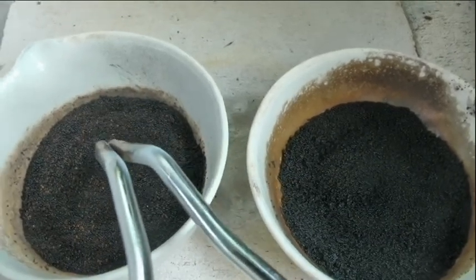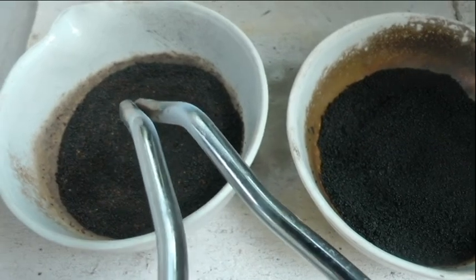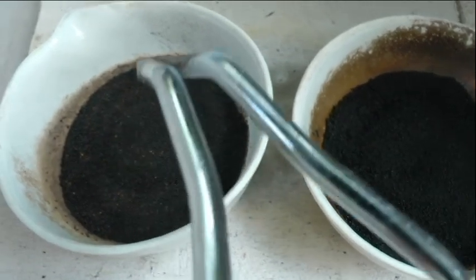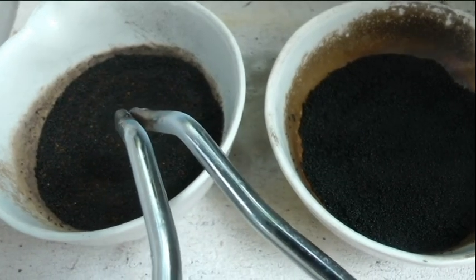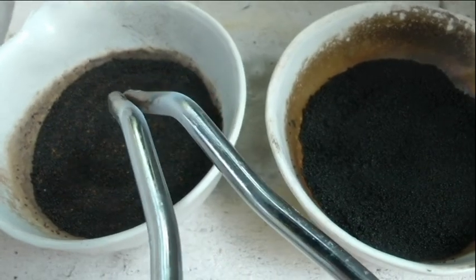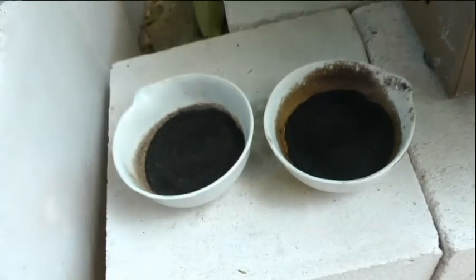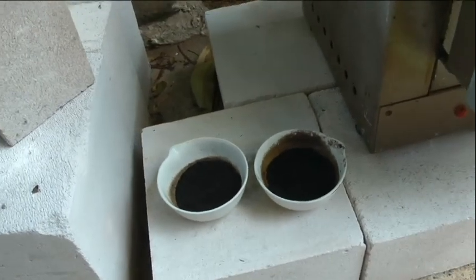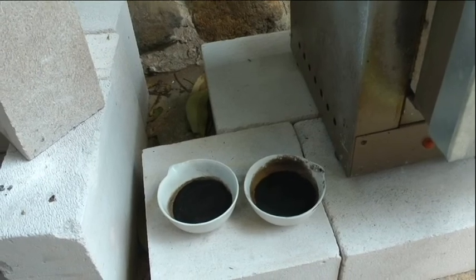This is a new batch I've been leaching for several days. Part agitated, part with the fish tank bubblers in it, part agitated by hand, and then I've run the clear liquid 3 or 4 times through the canister of resin. So there better be something in this lot. Okay.